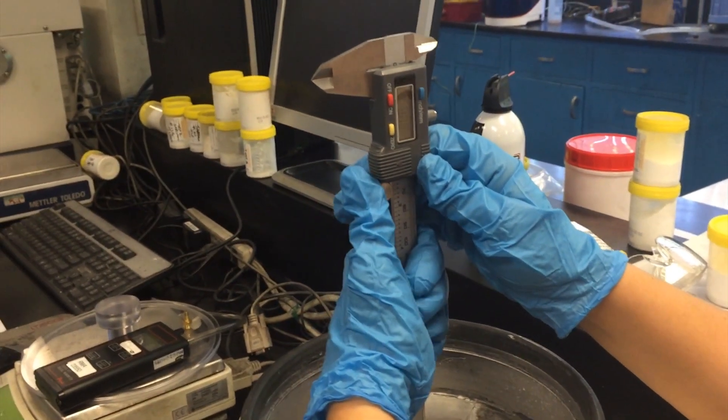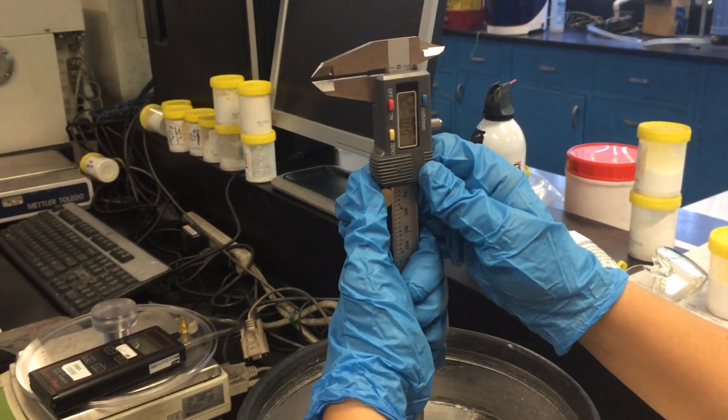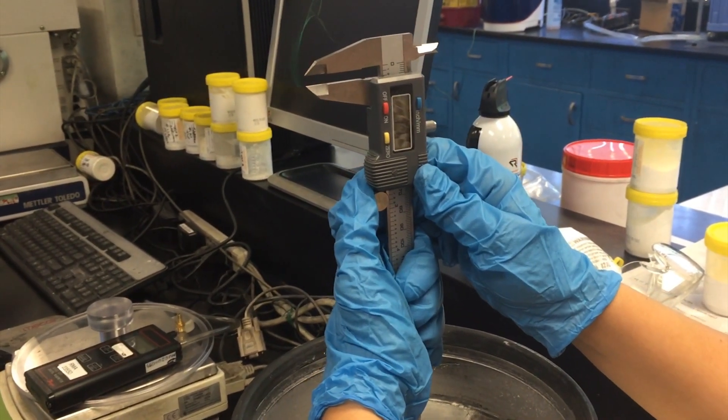When using the caliper, you want to make sure that you do hold it as vertical as possible so that it does get the proper height reading.